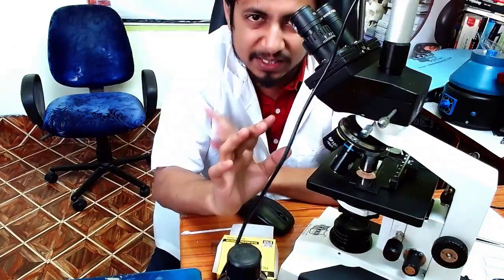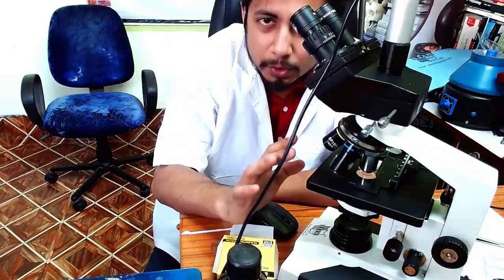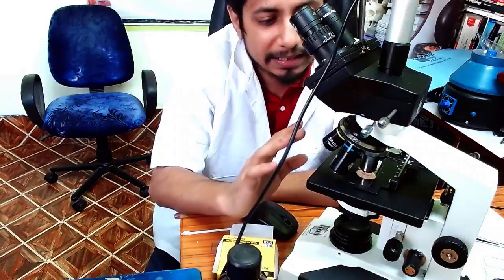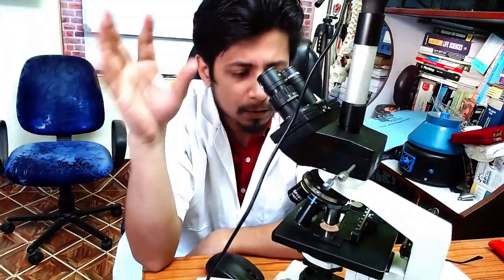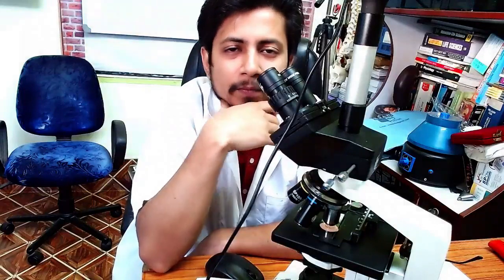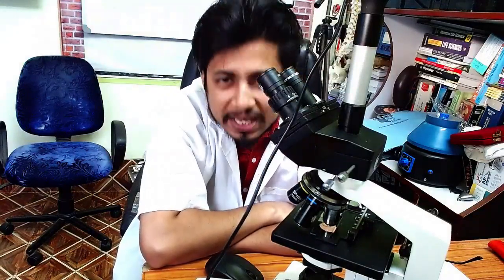Put your eye to the eyepiece and rotate the fine adjustment until you see a properly, clearly visualized image. This is the way to focus a microscope — the best possible way. If you try this a couple of times, you will never need anyone to help you focus a microscope again, and you will never damage a single specimen slide or objective lens using this process.